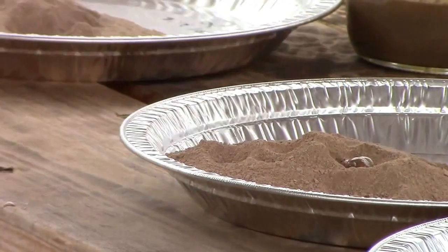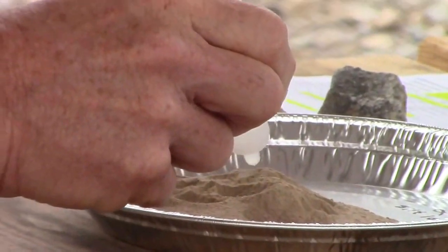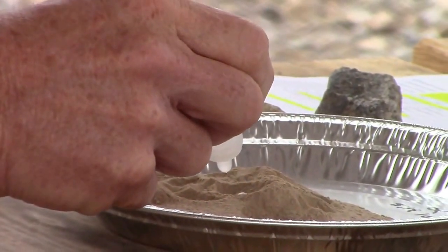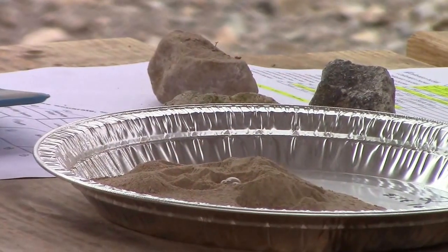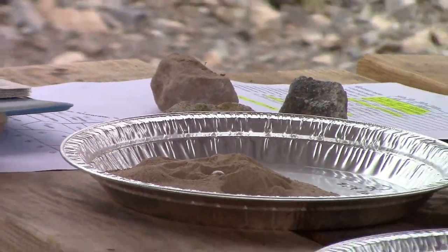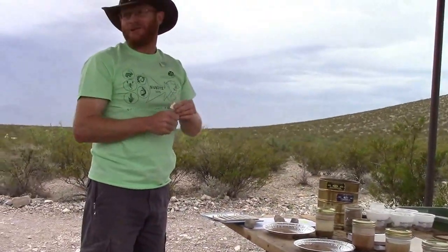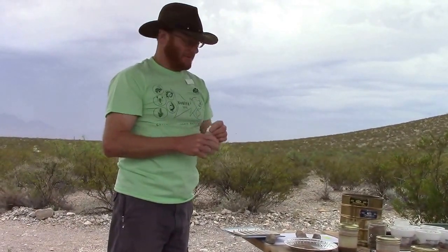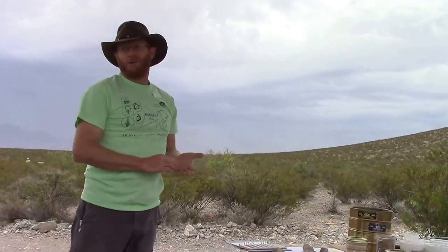Another strong soil there, and finally another strong. Most of these soils are from New Mexico, and because we're in an arid environment, it's not uncommon to find a lot of carbonates in soils of all horizons here.